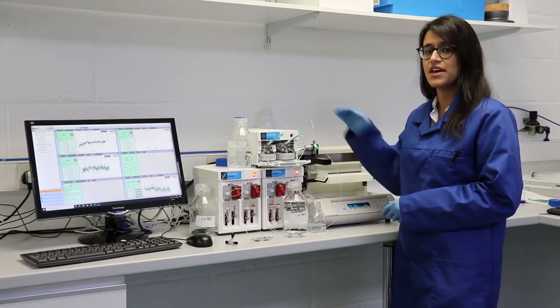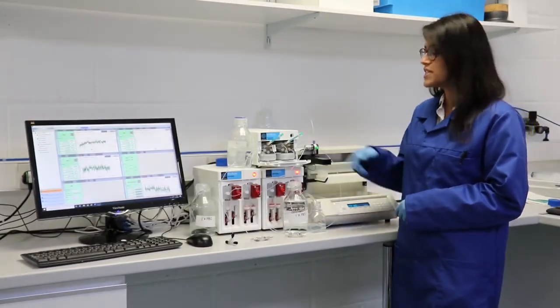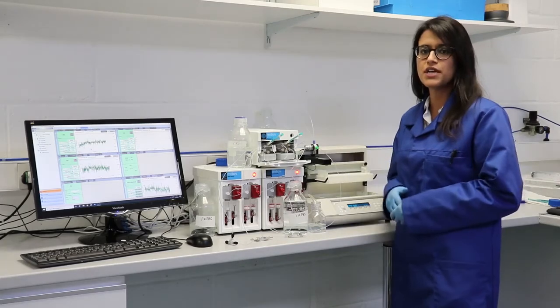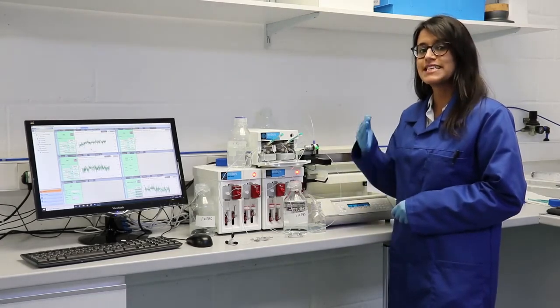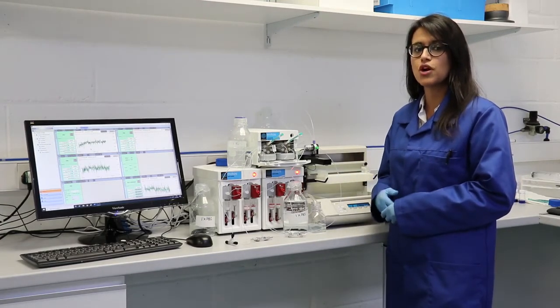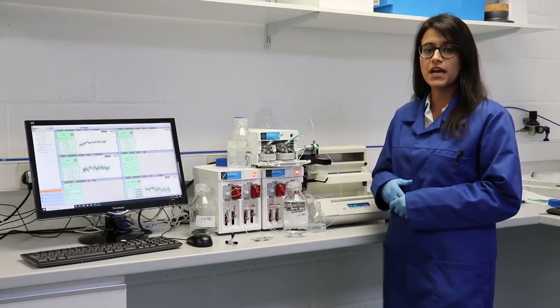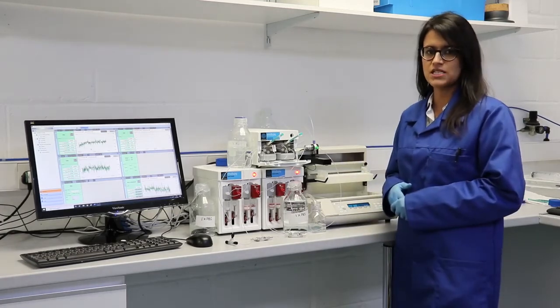This occurs here at the ASV via two different syringes. You can see here 1 and 2 that fit into this luer fitting. When running repeats, you will load the total amount of your NP precursor, nanoparticle precursor, required for all your repeats. The automated sample valve will gate your repeats in the sample loop, only releasing enough NP precursor to run one repeat at a time. Between each repeat, the system automatically washes the fluidic pathway with your driving fluid to ensure no residue from the previous experiment is present.